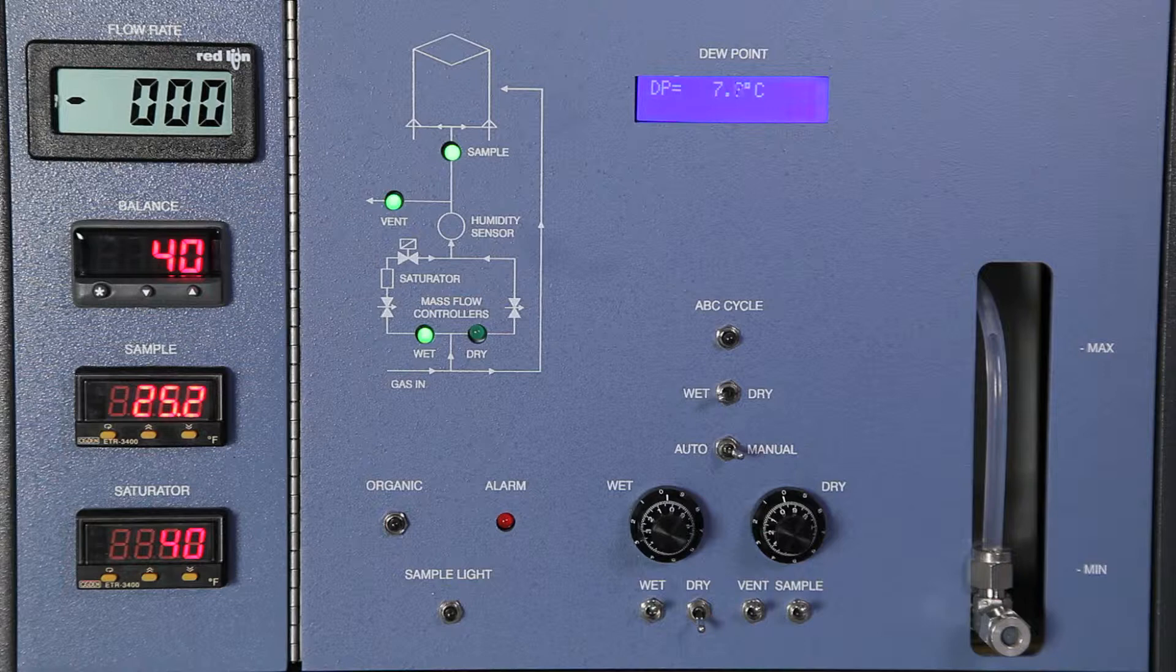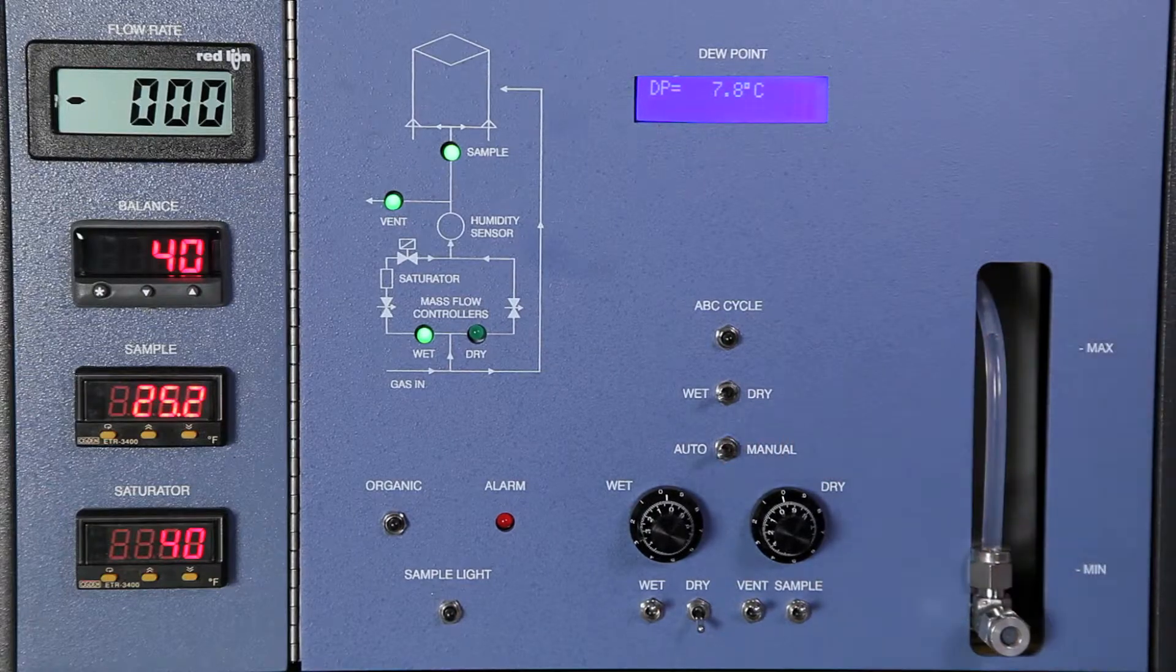Now let it sit to stabilize for up to 2 hours. Make sure the control toggle is set to auto.